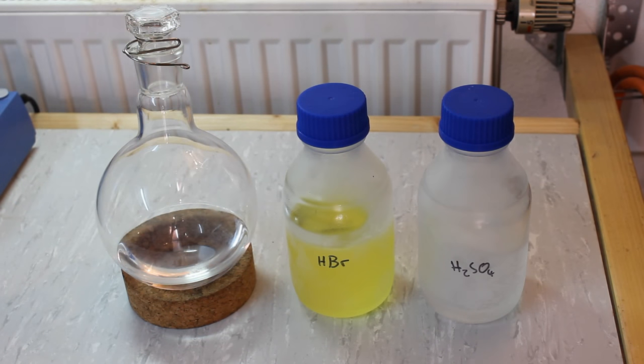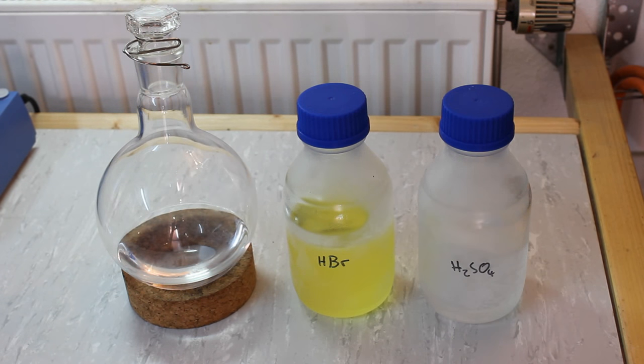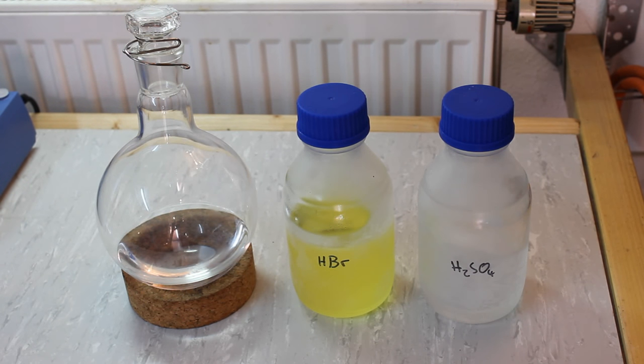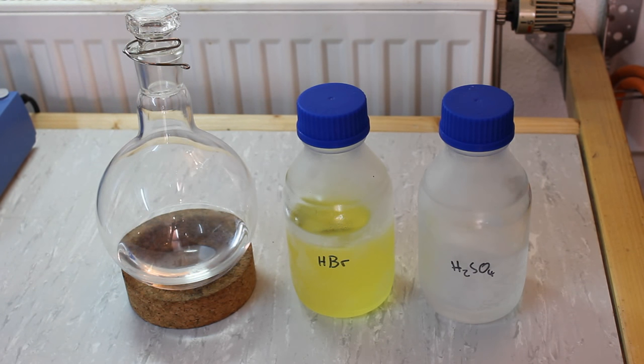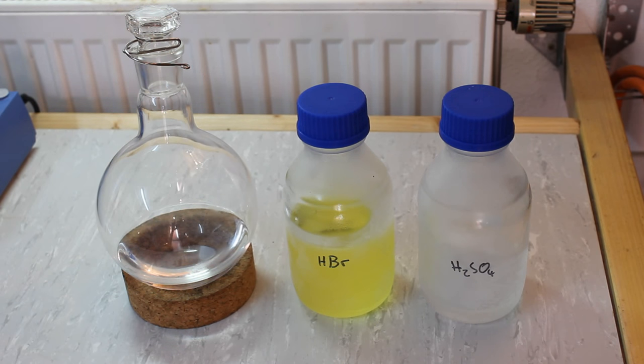Hello and welcome to Chemex. Today we'll be synthesizing ethyl bromide or bromoethane by reacting ethanol with hydrobromic acid.